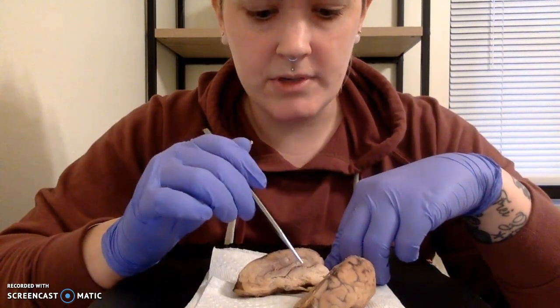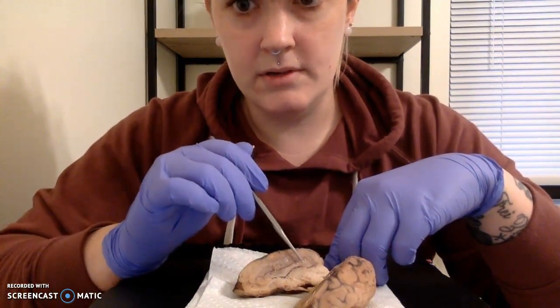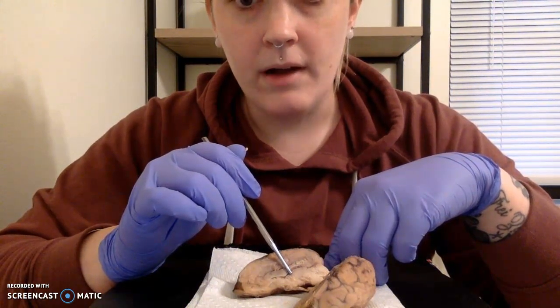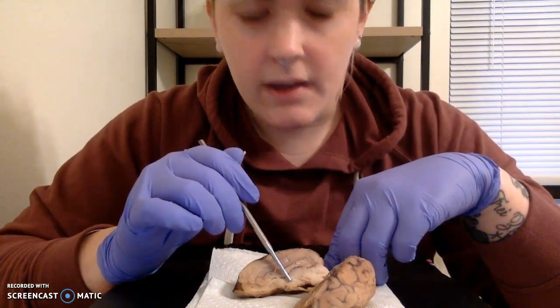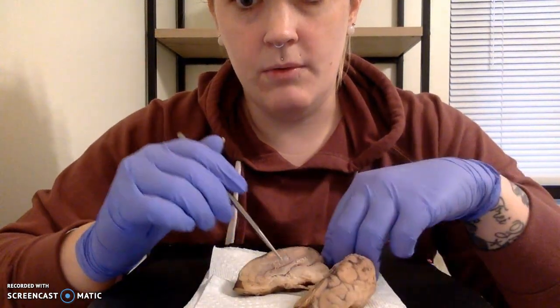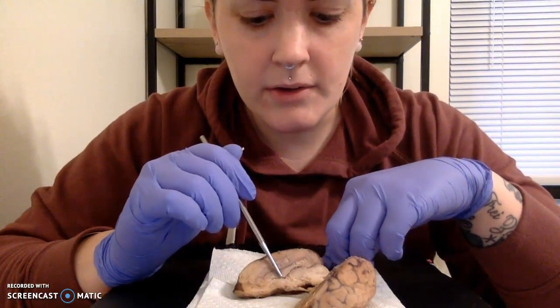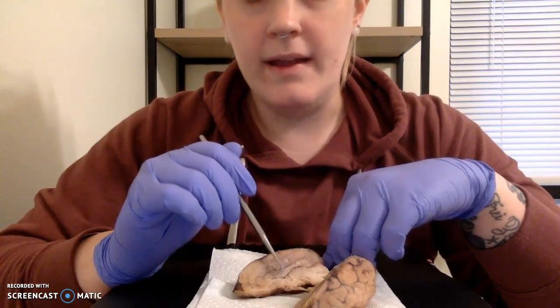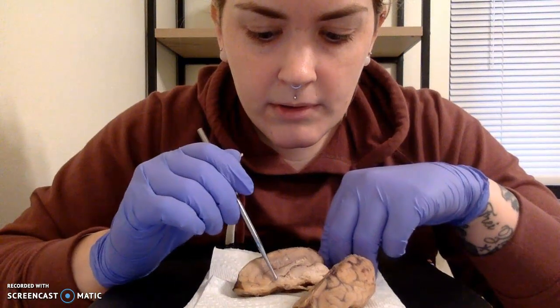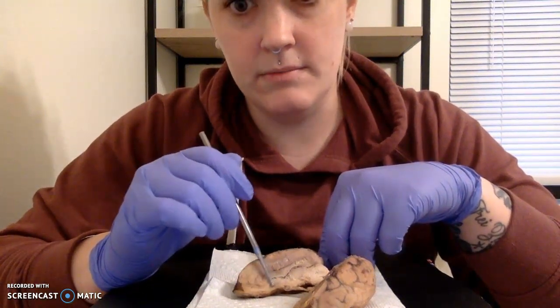So back to what we were looking at. Our corpus callosum is going to be right about here in the brain. Our thalamus is going to sit right below that in this roundish feature that's right here. Our hypothalamus is directly beneath that, right about here. And then I want to look at what we're calling our midbrain, which is right in the middle of the brain. Right here, you can see it pretty clearly. And then our medulla oblongata. So our medulla oblongata is going to be this longish feature that's here at the base of our dissected brain.